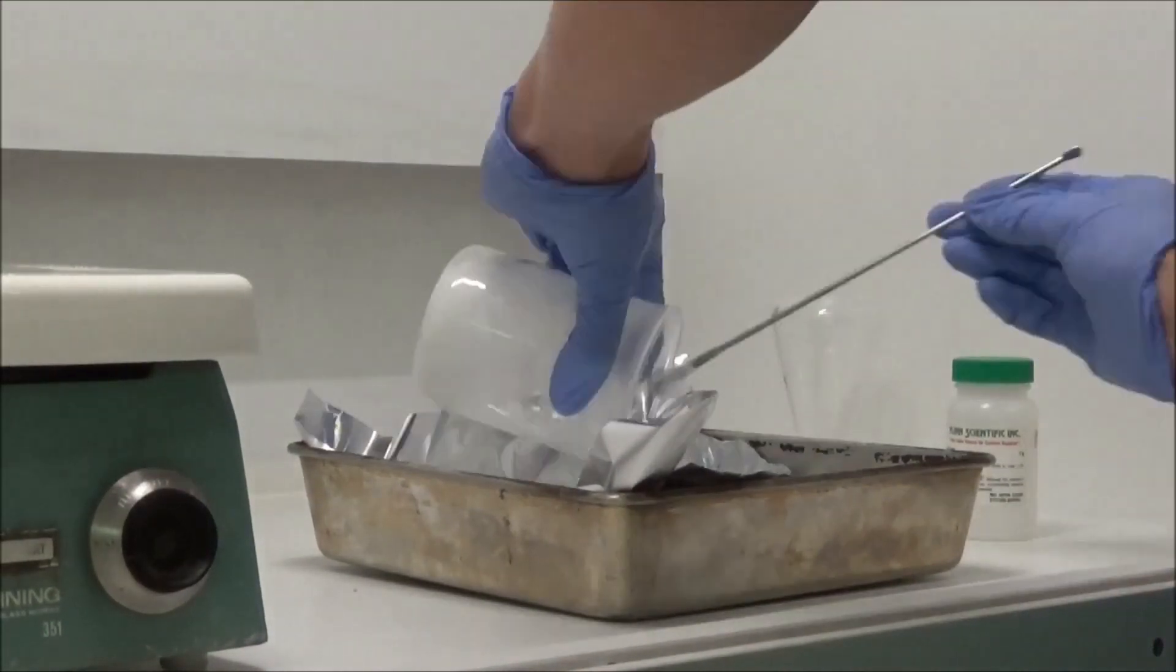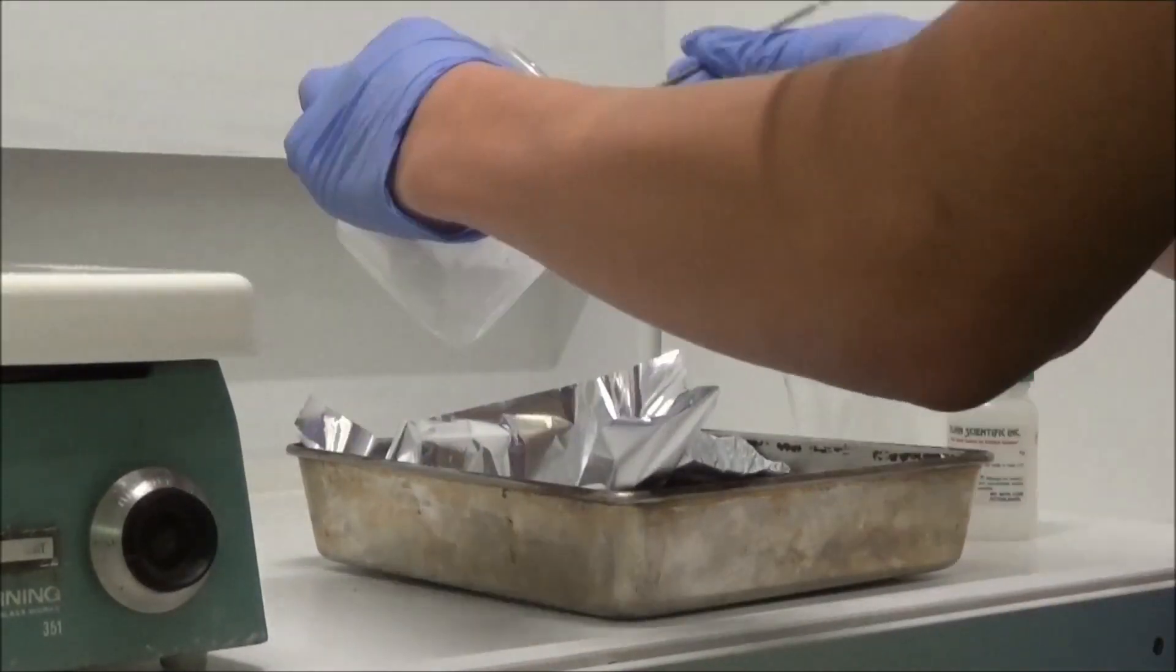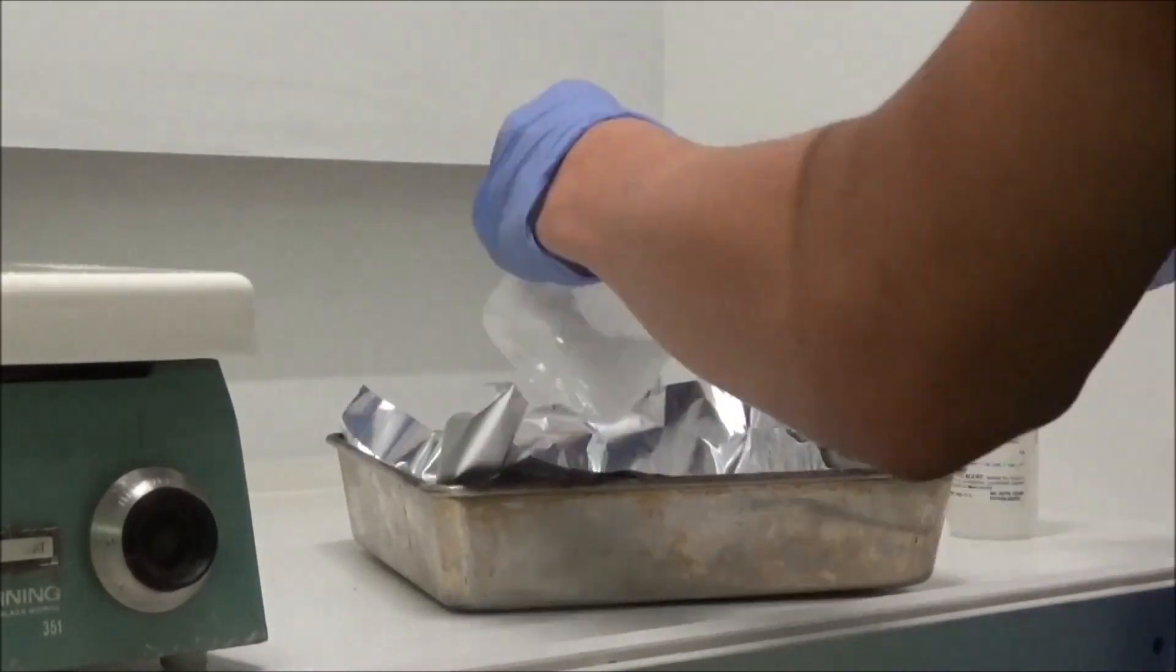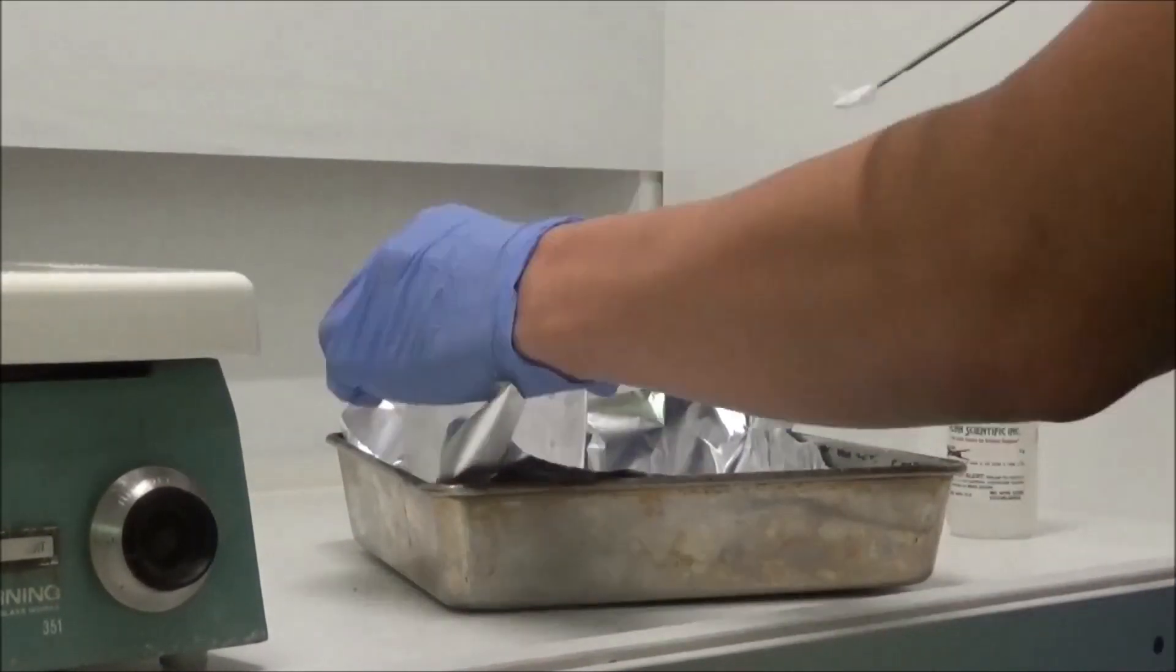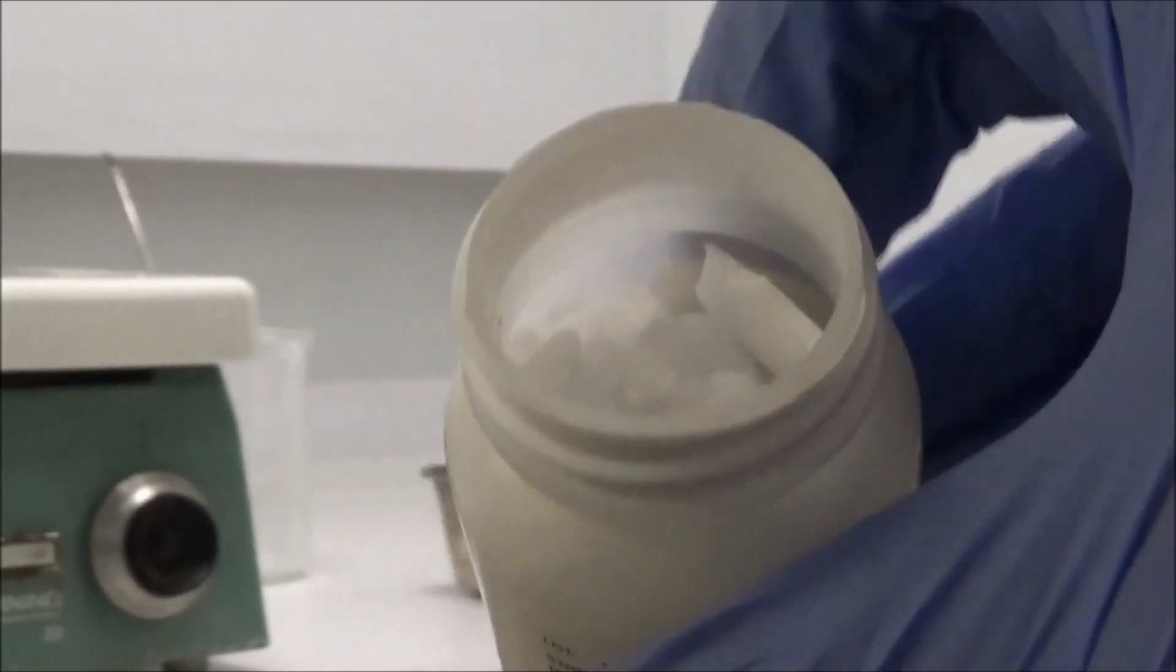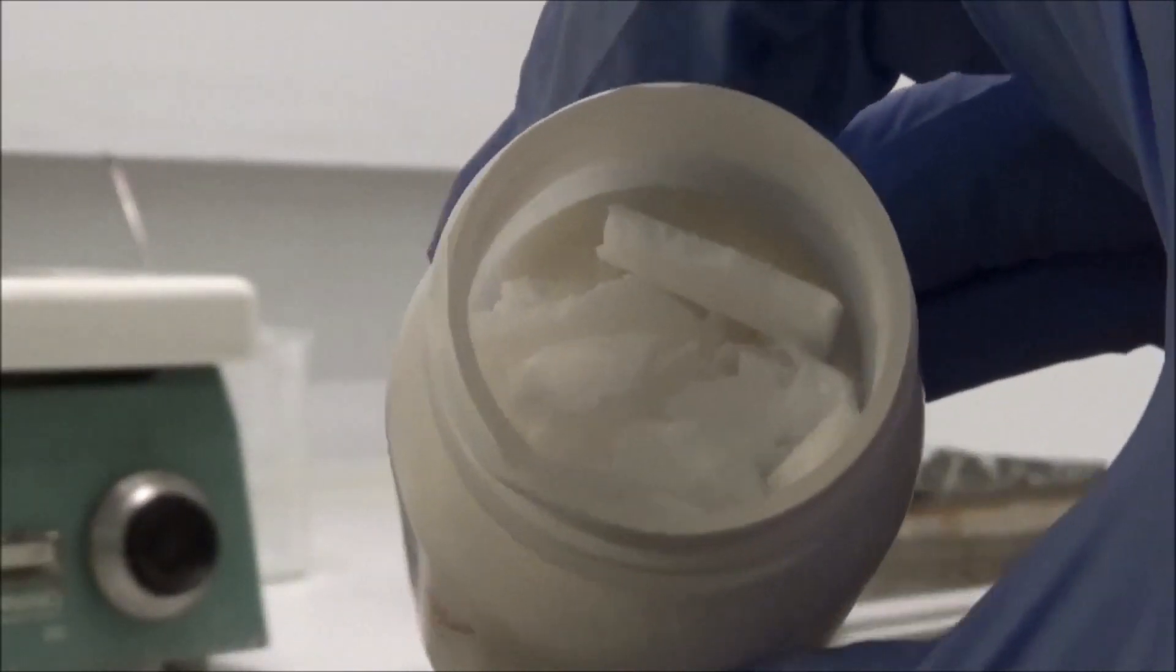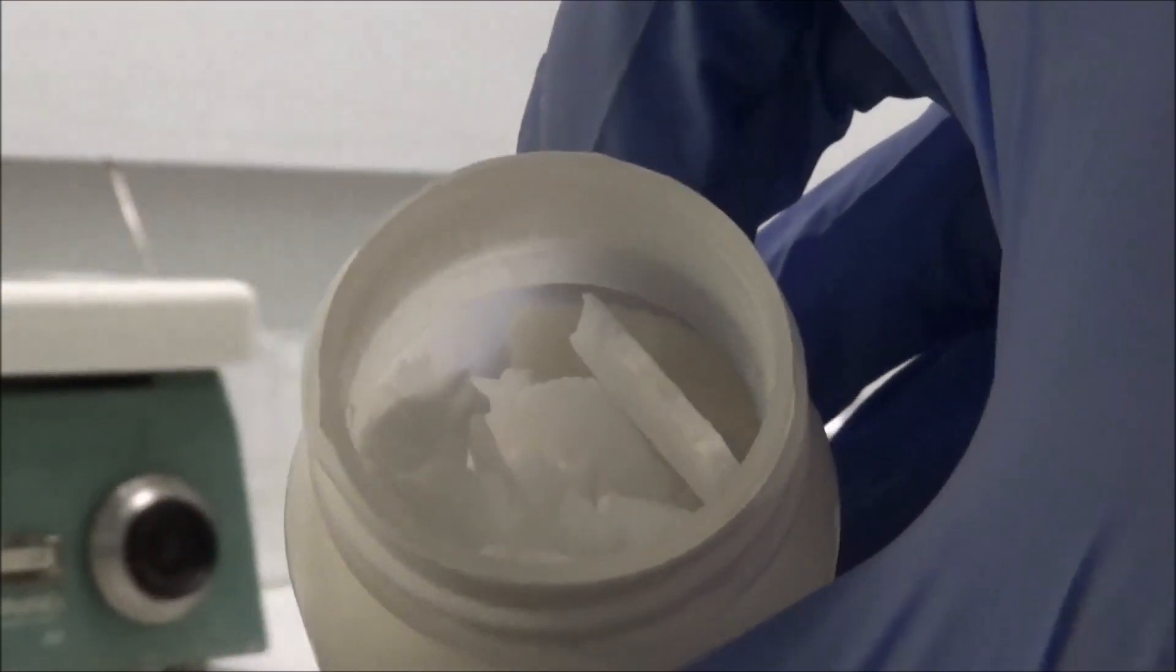The product solidified and was broken up and placed into a bottle for storage. Here is the pure white phthalic anhydride.